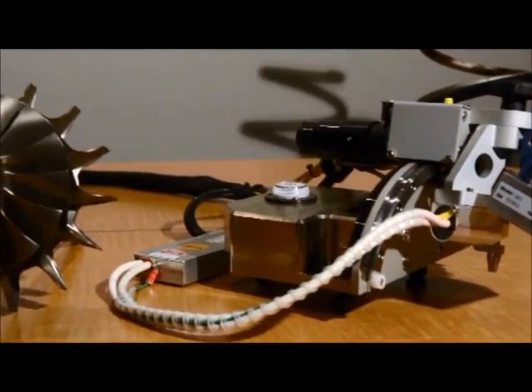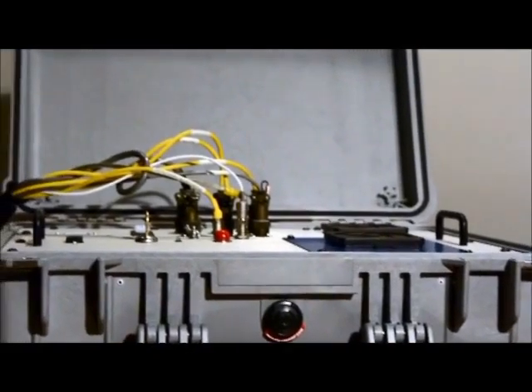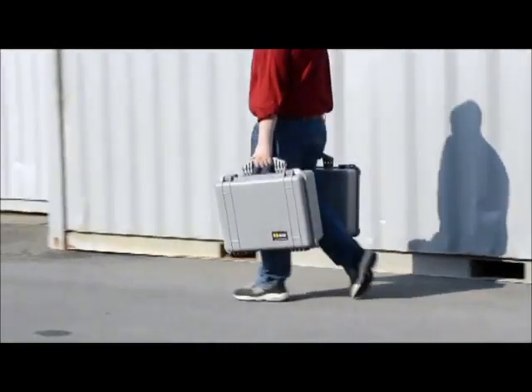The nice thing about it is it's extremely portable. So if you need to get into not only hard to access locations, but if you're at a remote site, for example on a flight line, you can take 2 briefcase-sized cases along with a laptop computer, and you have everything you need to run MAX. MAX can give you measurements within a couple of minutes, and they're every bit as precise as what you would find in a laboratory type diffractometer. So you can get very fast measurements out in the field. You don't have to dismantle your system to see if the part's going to survive service or not.